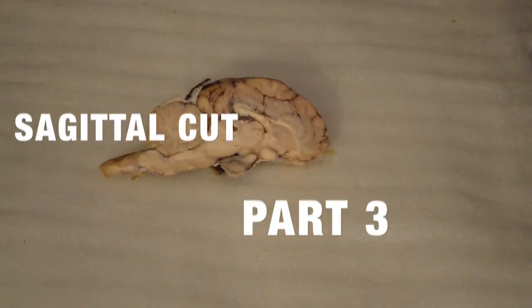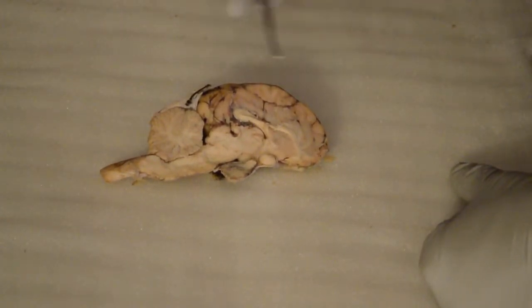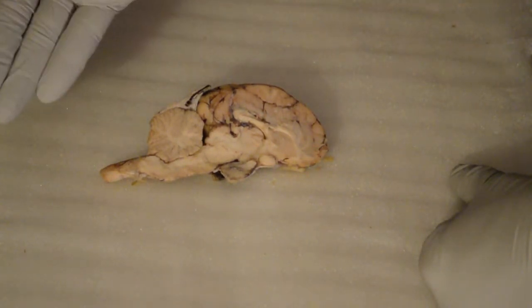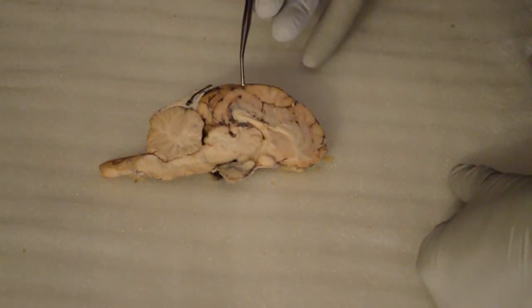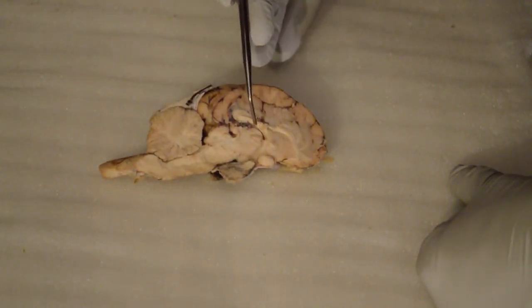Just want to give you guys a quick update, this is part 3 of a beautiful cross section of the left side of the brain. I took it from the mid-sagittal region and I cut it right in half, and here we have a beautiful view. Pointing to ourselves, the frontal region, the parietal region, the occipital region. We have here the cerebellum.